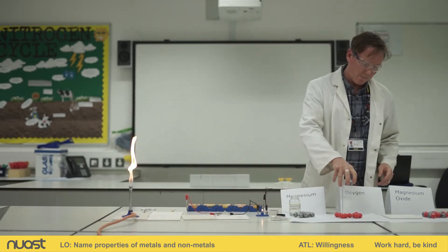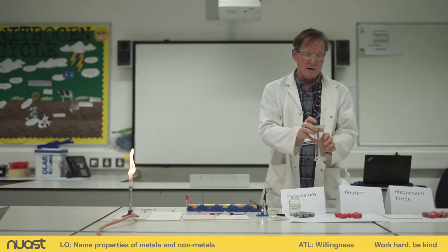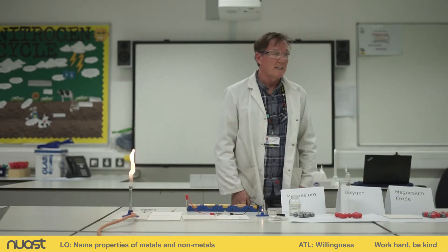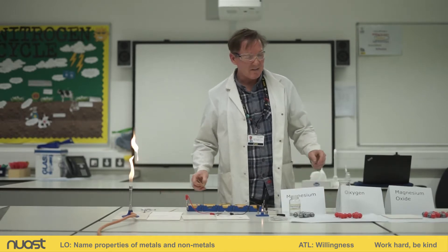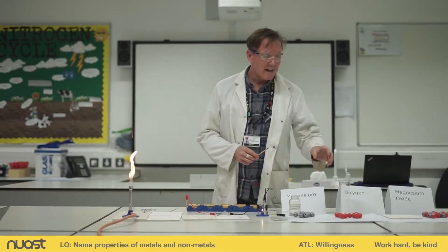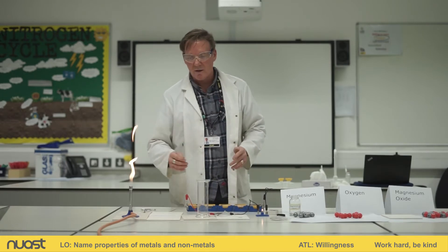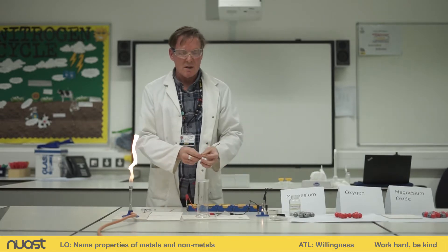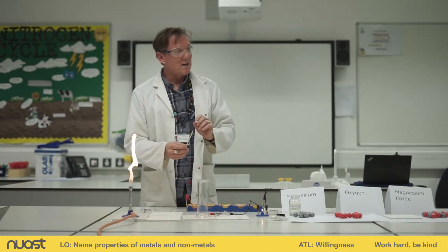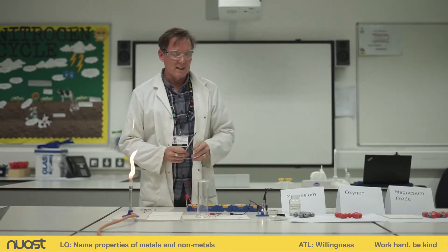Here we have some oxygen — not really much to see. It's in a gas jar. It's a gas, it's invisible, no colour. But we know something about oxygen: oxygen likes to make fires, so it will support burning, combustion. I'm going to test the oxygen to show you that we have got oxygen in there and to show you its properties. I've got my oxygen in the gas jar here. I have a splint — I'm going to light it and then blow it out so it's glowing, and then put it into the oxygen in the gas jar.